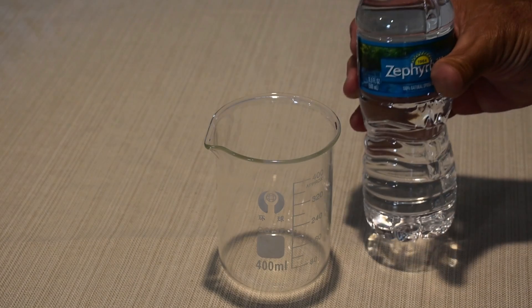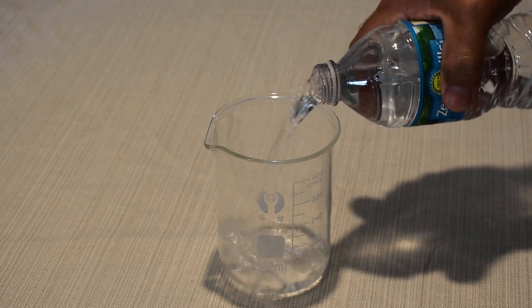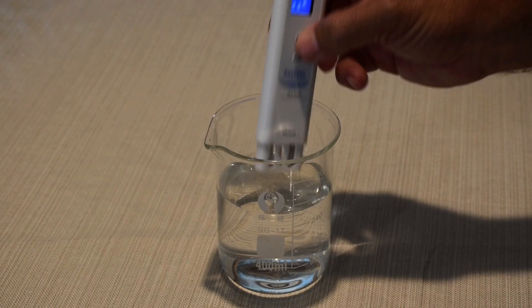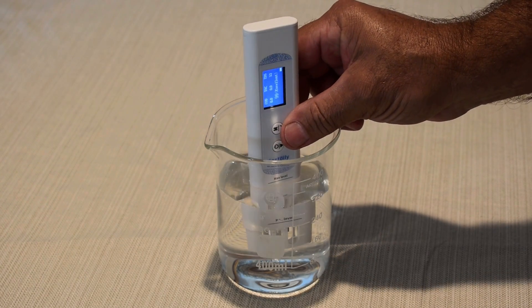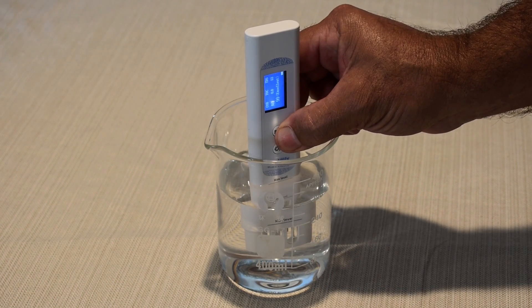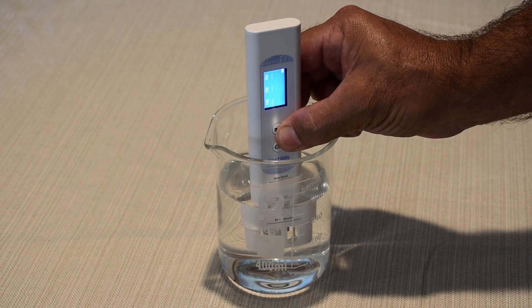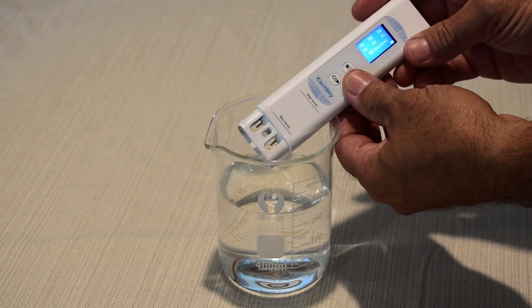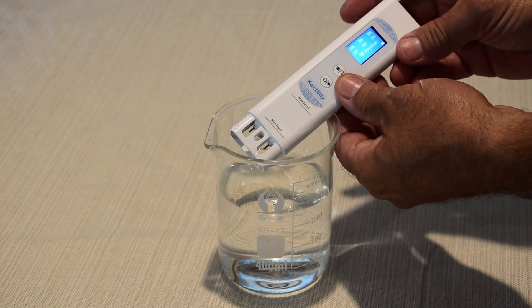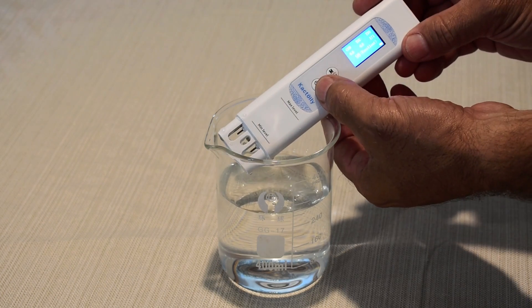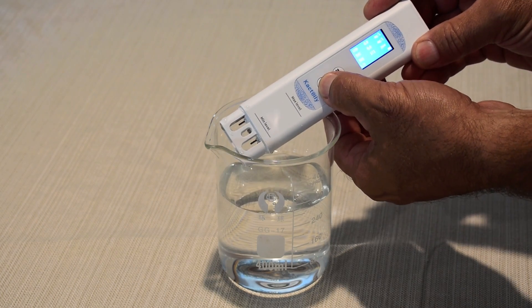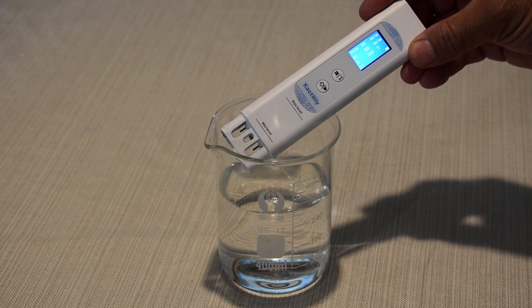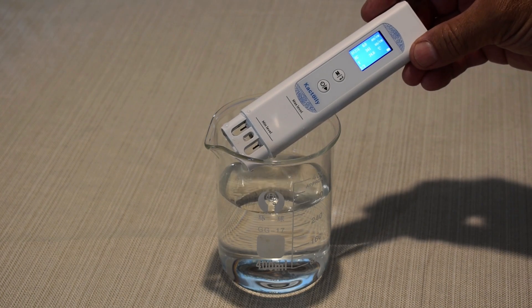Now Zephyr Hills. Give the M a quick push. 98. COD and TOC are both zero, TDS 171. Electrical conductivity is 341, UV-275 is zero.